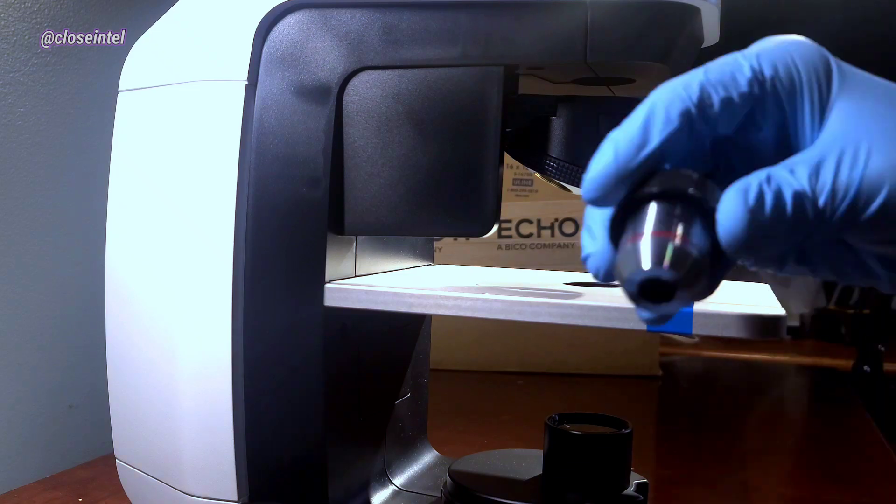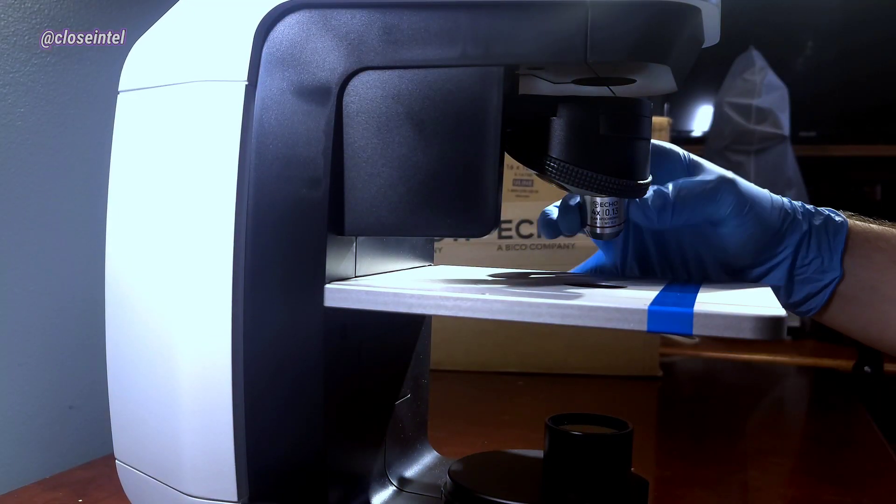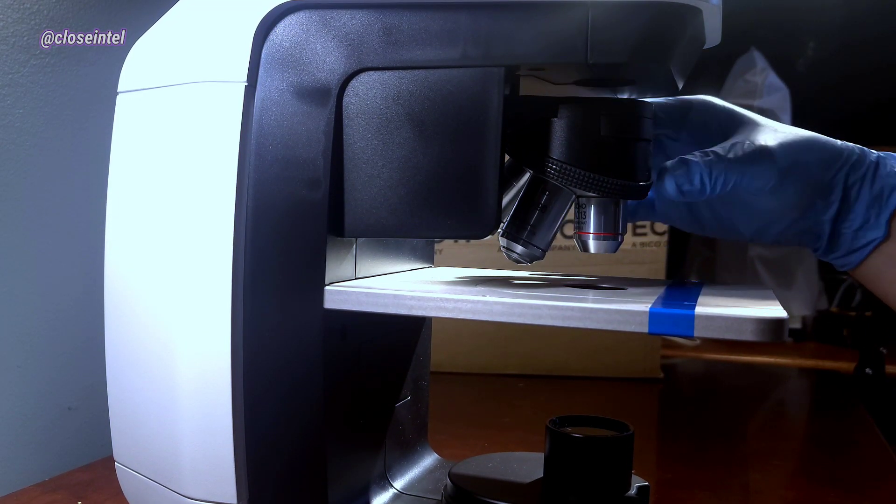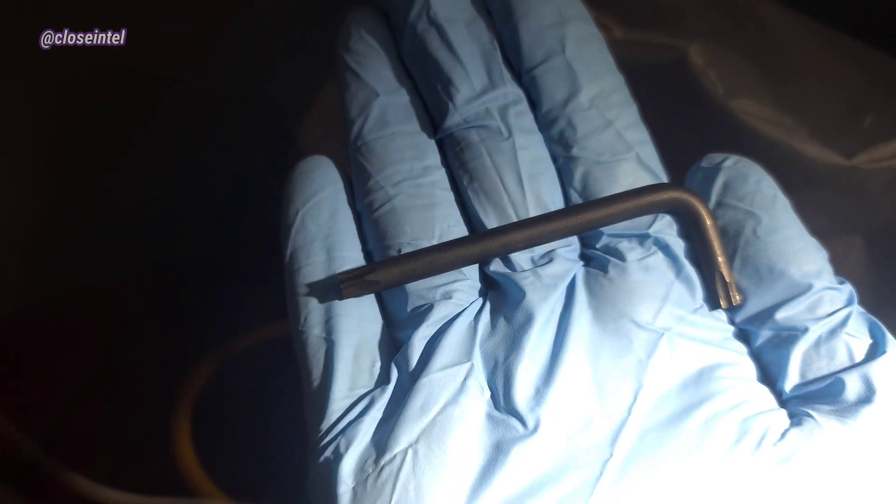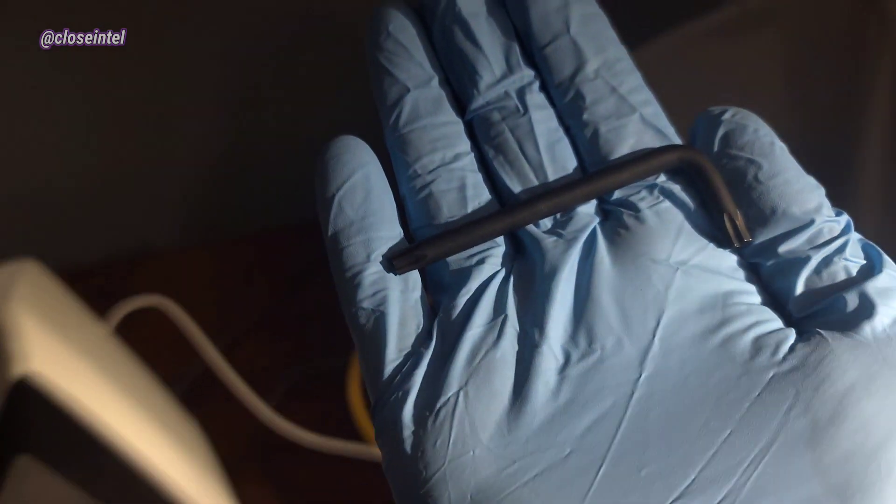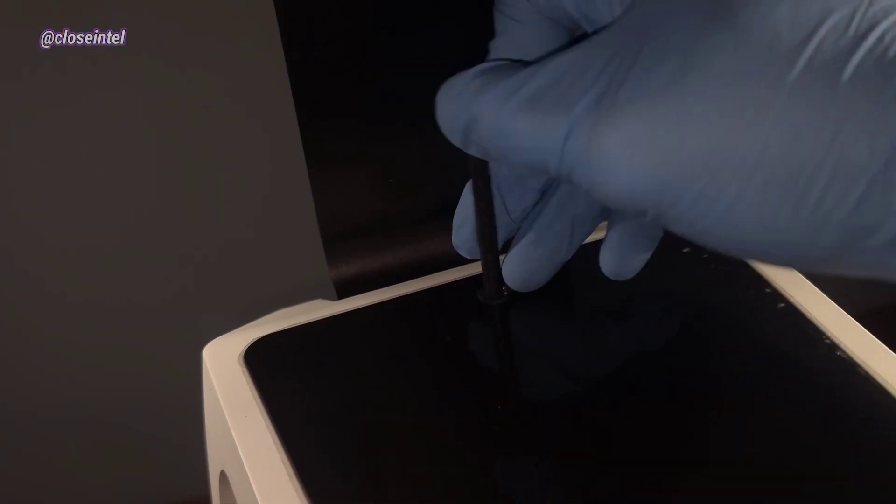The next thing to do is just screw in any of the objectives that you ordered and then mount the iPad. To mount the iPad, all you need to do is loosen a screw at the very top of the microscope with the tool that was provided in the box. You can then insert the iPad through a slot on the back of the microscope and then re-tighten the screw to make sure it's set in place.